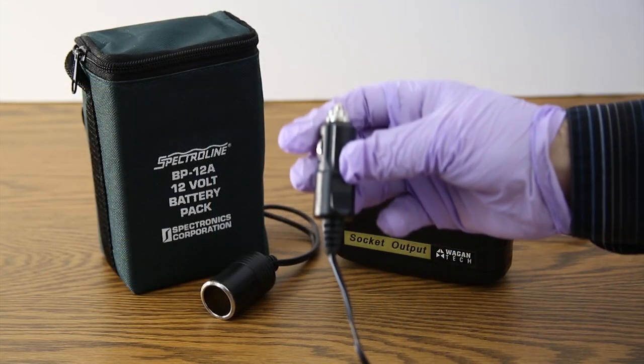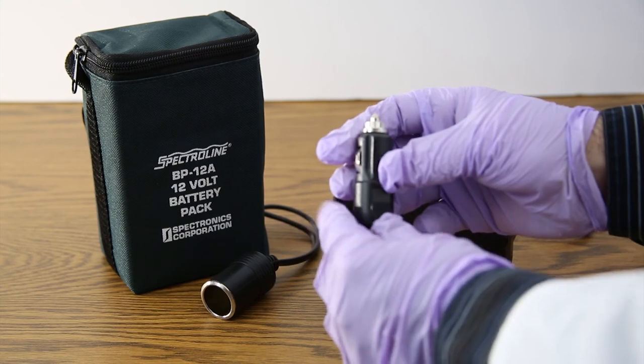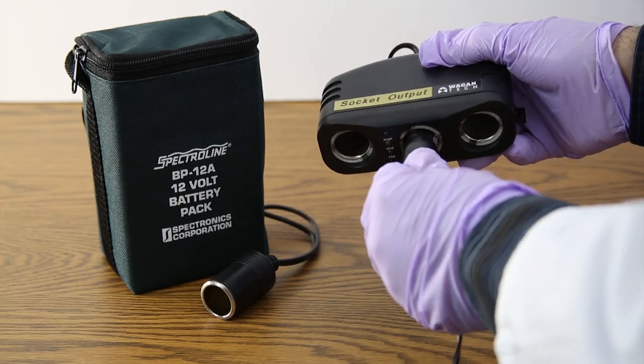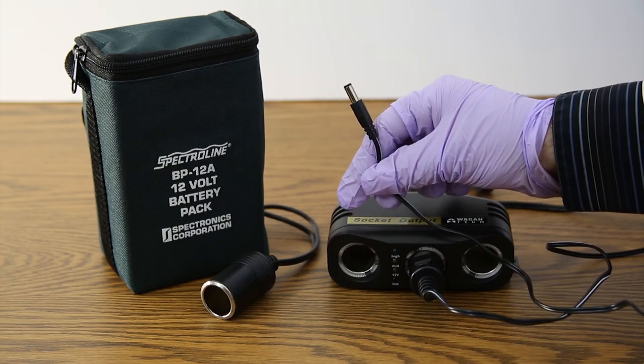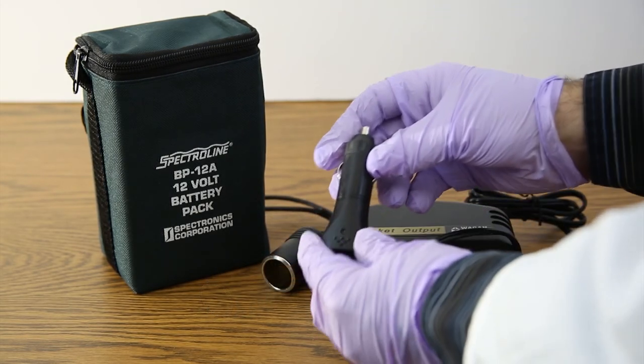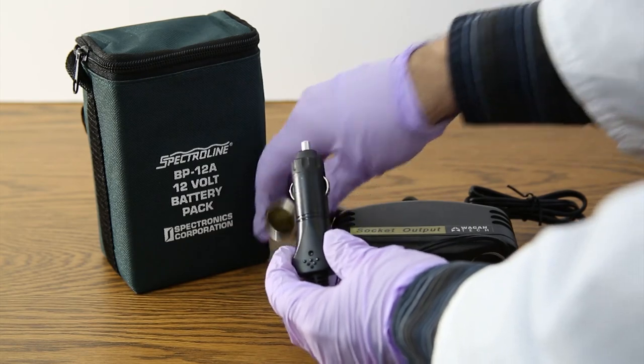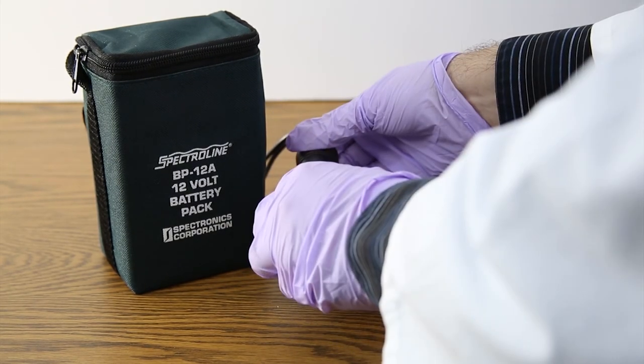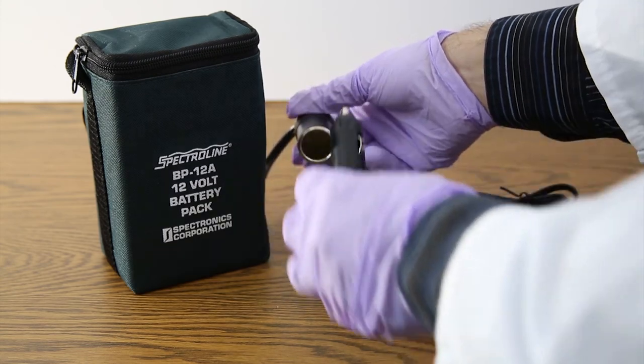To operate, plug the male 12-volt charge adapter plug of the connecting cords into the sockets of the three socket head and then into the input receptacle of the microscope, centrifuge, or colorimeter. Plug the input lead of the three socket head into the battery and turn the system on. Turn the system off by pulling the plug out of the battery output receptacle.